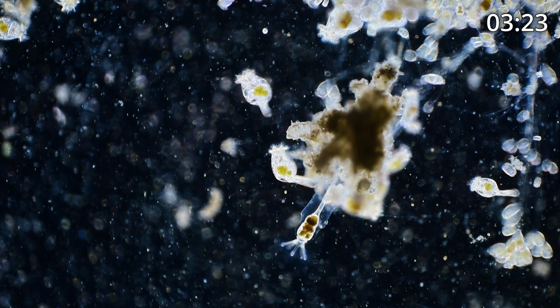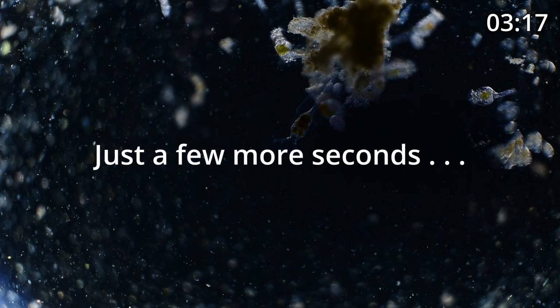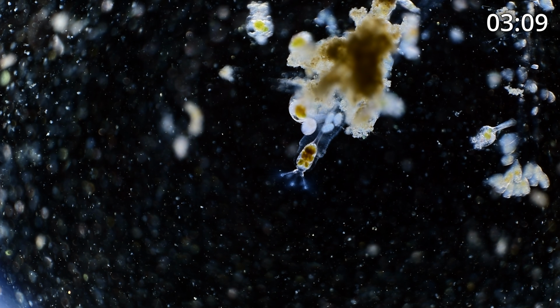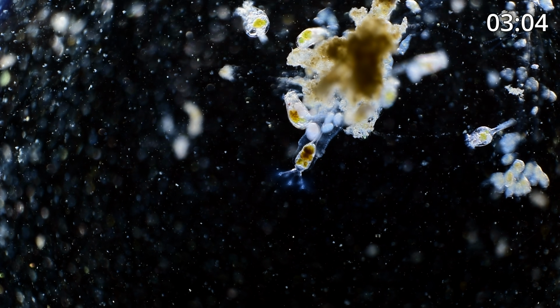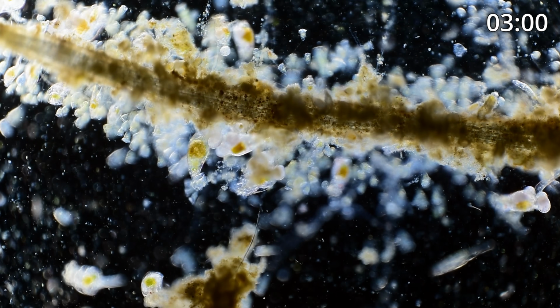Just give me a moment to get back out and put our dark field filter back on and get back here. Okay, so what did I do? There we go. So now we're back in dark field, wide angle. And oh, this is just such an active scene. Look at the amount of life.